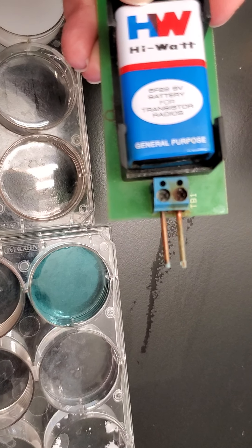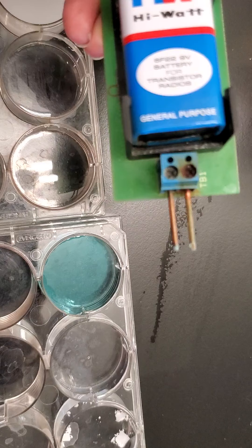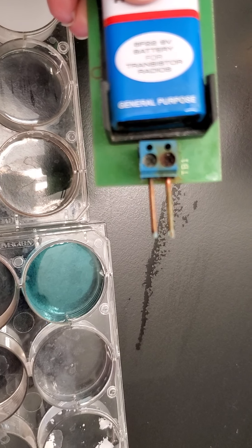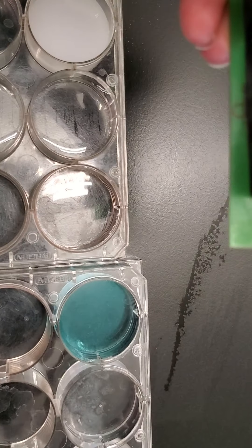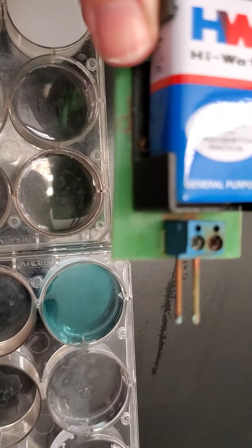It has two little metal prongs to dip into it, so you need the two metal prongs for the positive and negative charge. Mine's a little dirty—someone didn't clean it well last time.